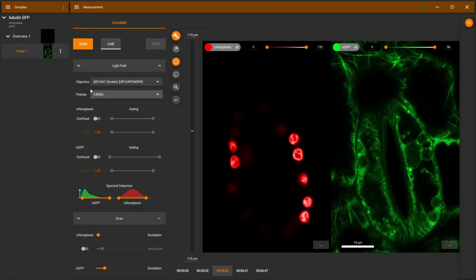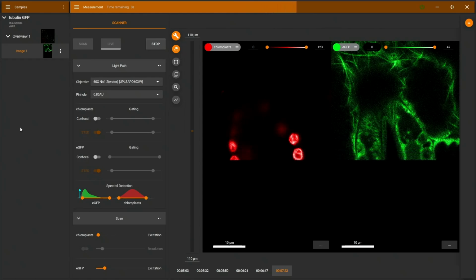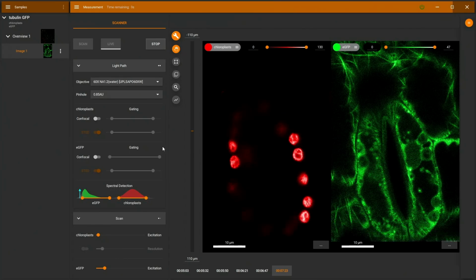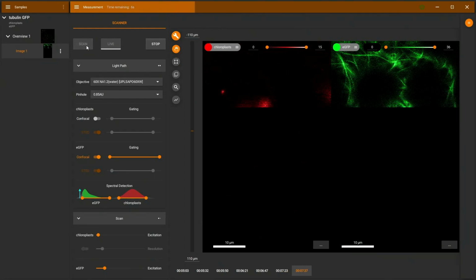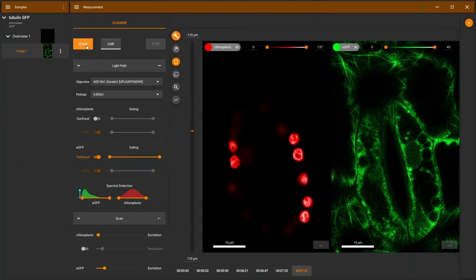Going back to the original image here, I can record this again without time gating, but with the correct spectral settings. So this is the default settings, and there's only very little crosstalk. If we now switch on time gating and repeat this, we can see that even the last bit of autofluorescence here from the chloroplast has disappeared, and we really have just black holes where we would have slight crosstalk with the non-gated settings. So really good tool here to get rid of the chloroplast autofluorescence.